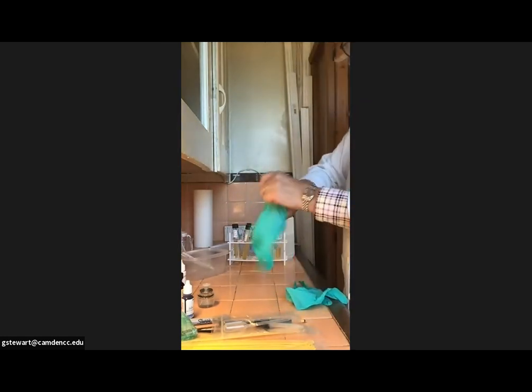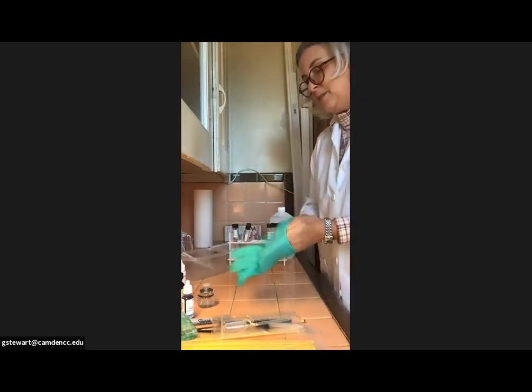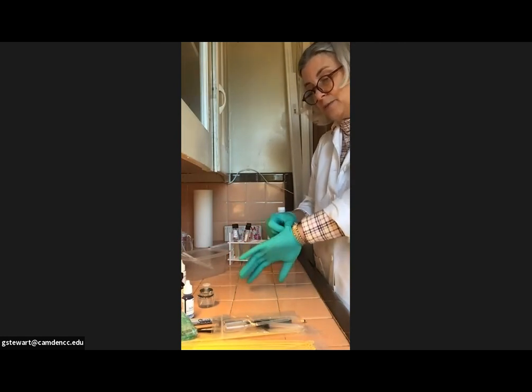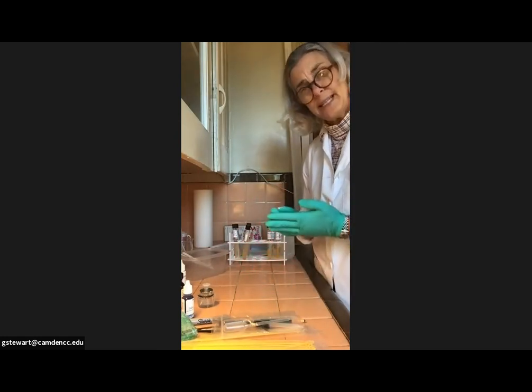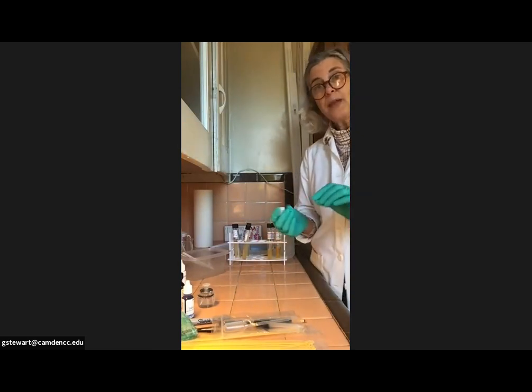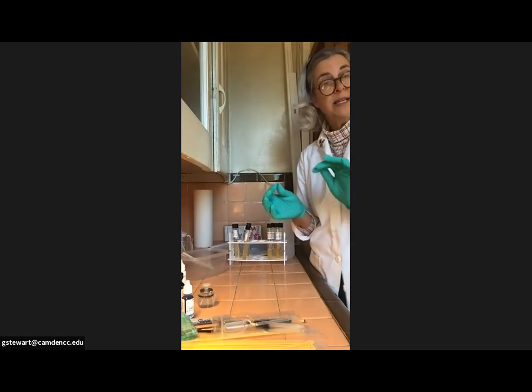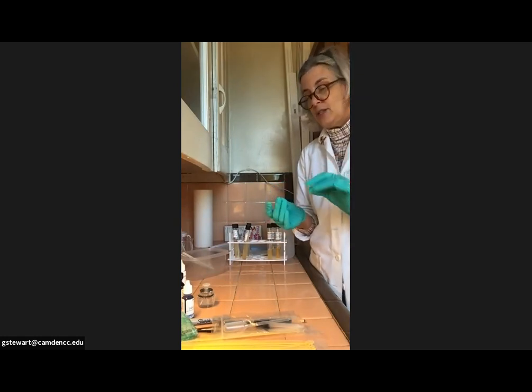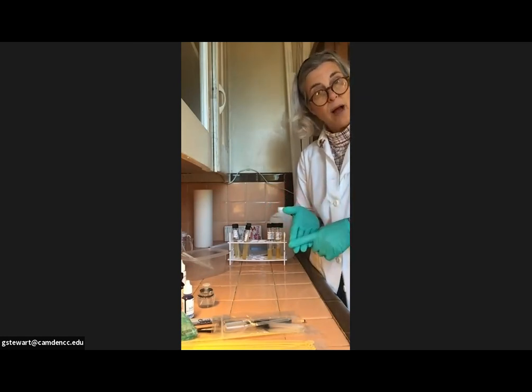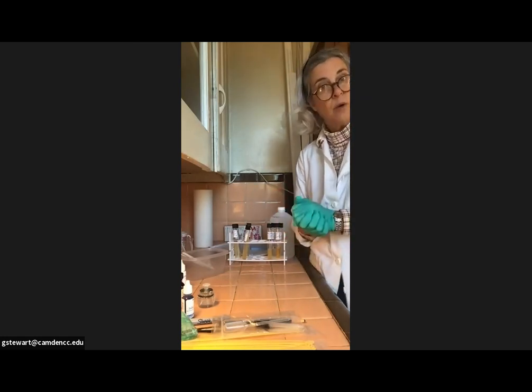I am going to wear gloves today just because we're staining and I don't want the dyes all over my hands. If you prefer not to wear gloves for the staining procedure, or if your fingernails cut through the gloves and you do get stain on your hands, I would recommend the following stain removal procedure. I would use a light cleanser, like a soft scrub, or some Bon-Ami, something that's not super abrasive. And I would try to use it dry. You'll get most of the stain off. And then of course you can use rubbing alcohol. Will probably remove most of the rest of it. After a couple days, it will go away as well.